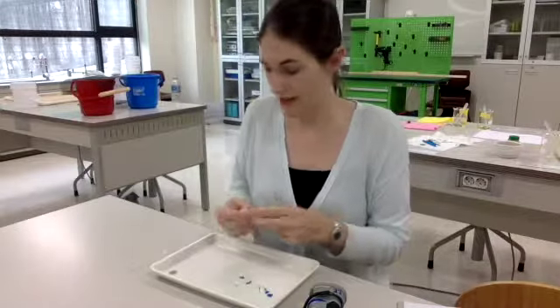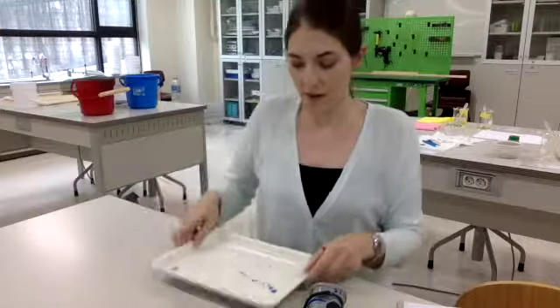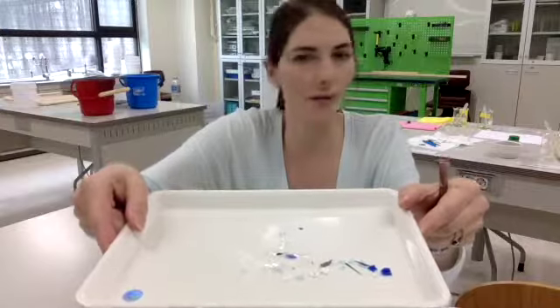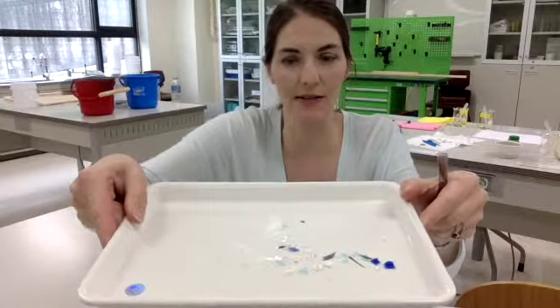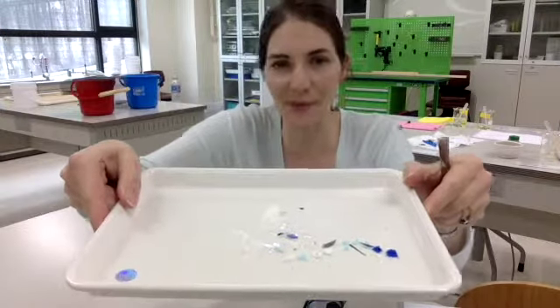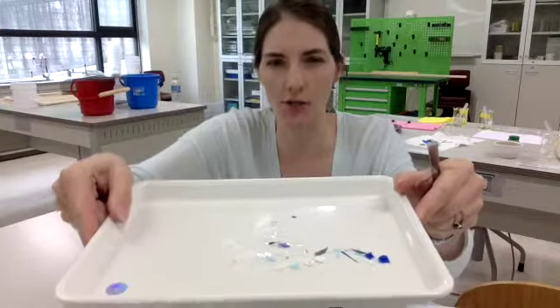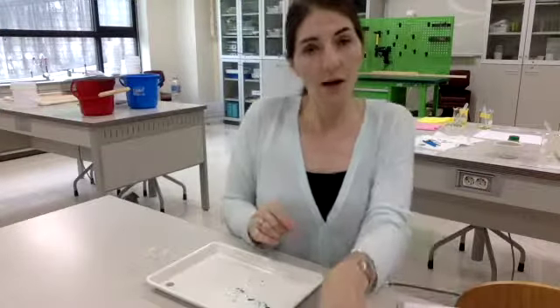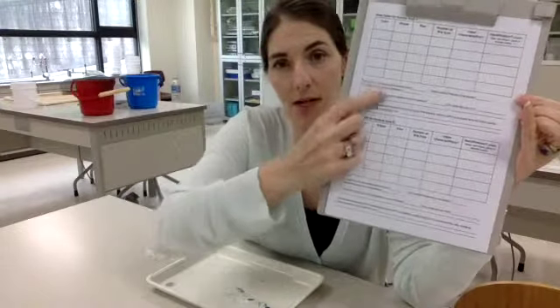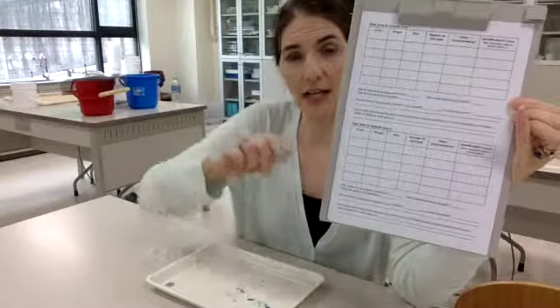All right, so let's see what I have here. Okay, so this is what it looks like. Now, you are hopefully not going to get this much microplastic, because if you do, that means that the beach is really, really polluted. Like I said, I put way more in than I probably should have, and I made this whole demonstration harder to do because of it. Each of you is going to get 2 data tables because we want you to sample 2 sites.